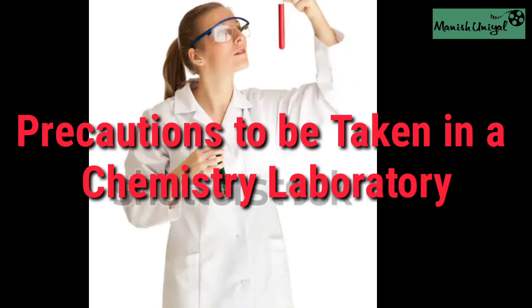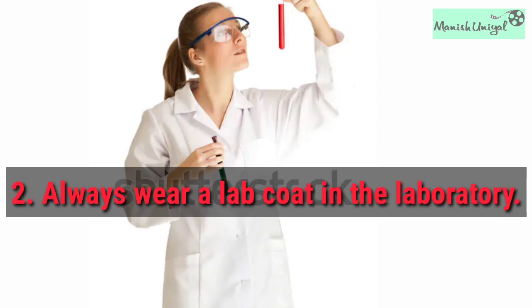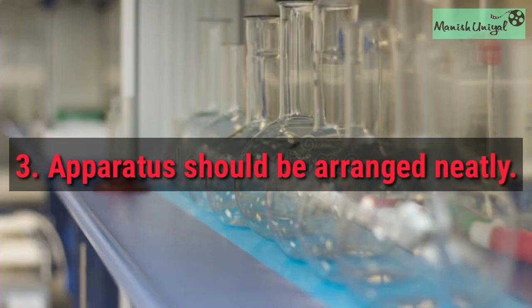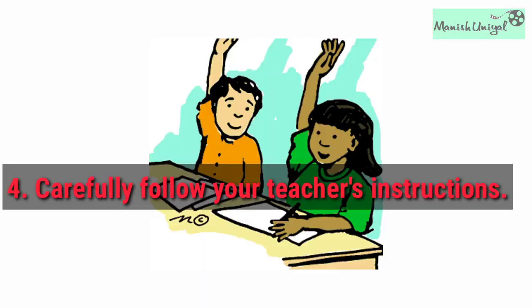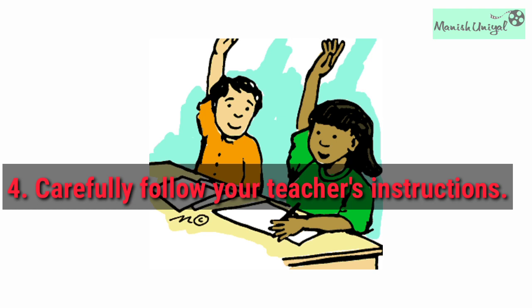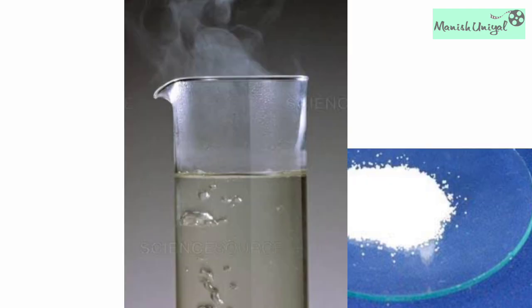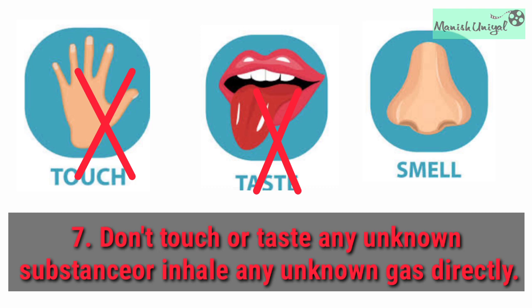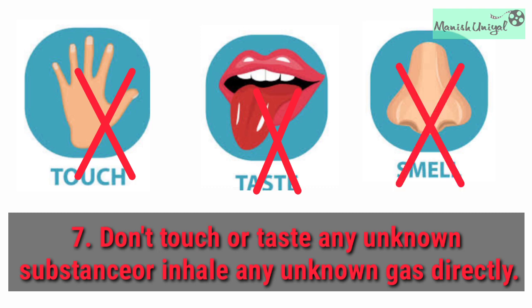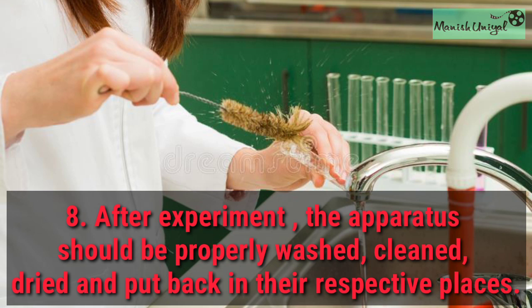Precautions to be taken in a chemistry laboratory: Do not work alone in the laboratory. Always wear a lab coat — it protects your clothes. Apparatus to be used should be arranged neatly before beginning an experiment. Carefully follow your teacher's instructions whenever you perform an experiment. Only small quantities of chemicals should be used. Hot objects should be handled with care. Do not touch, taste or inhale any unknown substance or gas. After the experiment, apparatus should be properly washed, cleaned, dried and put back in their respective places.